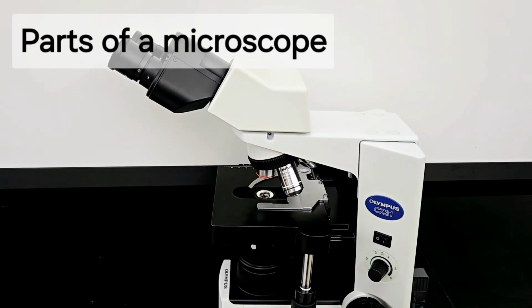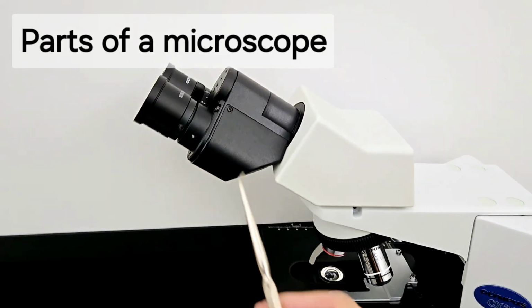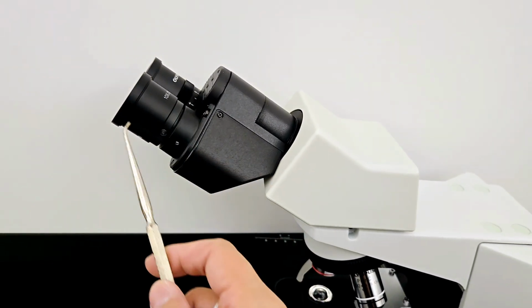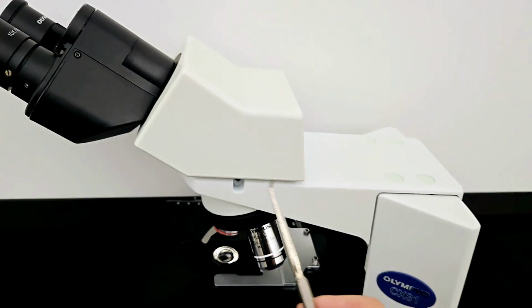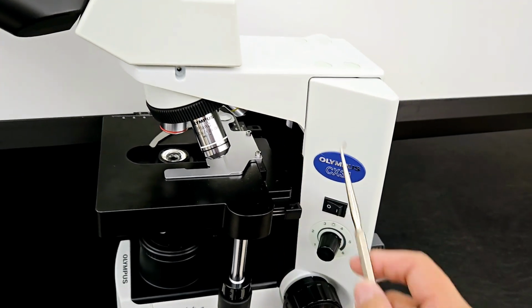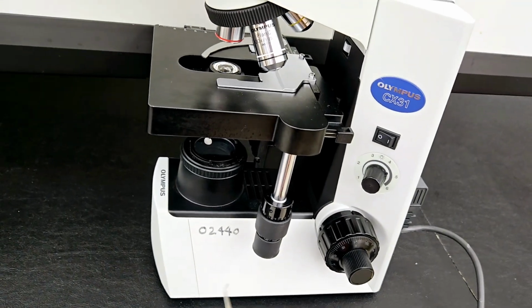Hi everyone, for this video I will go over parts of the microscope. We'll start at the top. This is the ocular lens where your eyes look into. You have the arm of the microscope. This whole area is the arm. And then you have the base of the microscope down here.